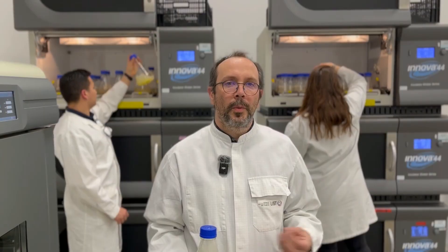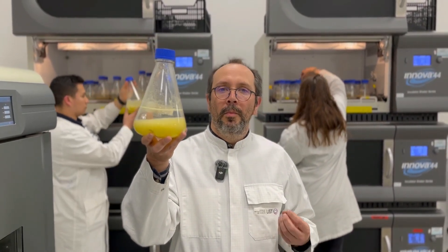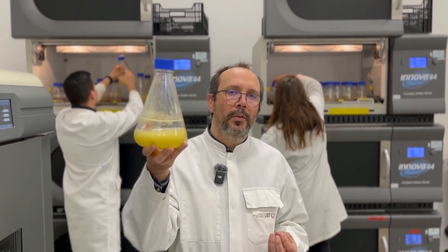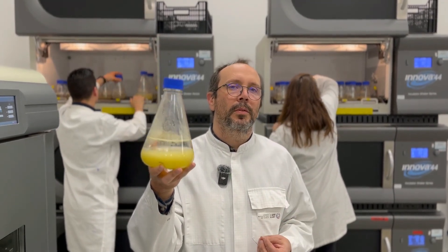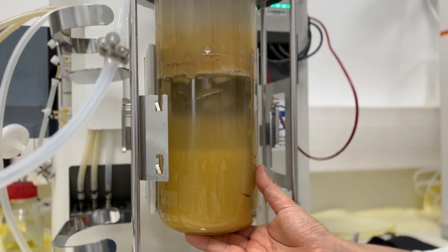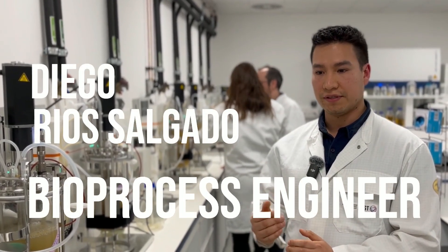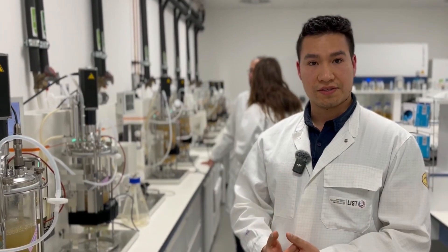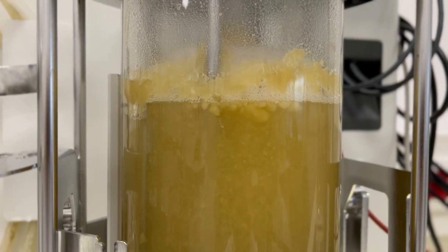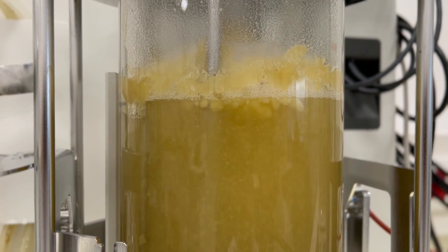As soon as we obtain the cells on solid medium, we transfer them into liquid medium to make them grow more efficiently into bioreactors and start the process optimization. In this lab, we make the link between the callus production, the callus turning to cell cultures, liquid cell cultures, and these liquid cell cultures then have to be upscaled.